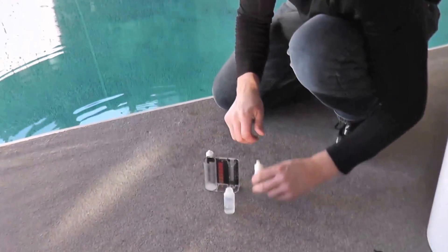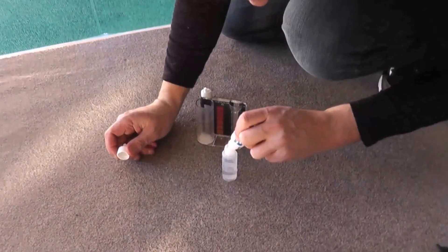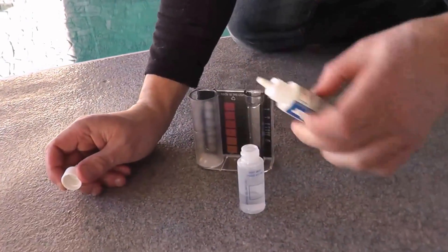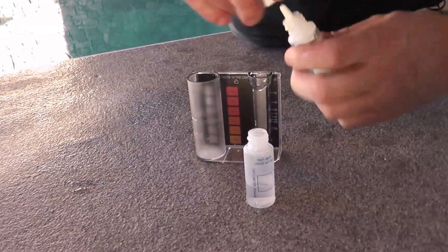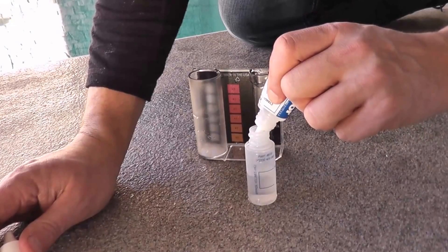Then you add the reagent to the 14ml mark. So we ran out of that one, getting some more here. So keep adding until we're up to the 14ml mark.